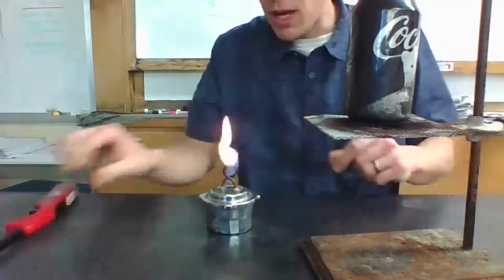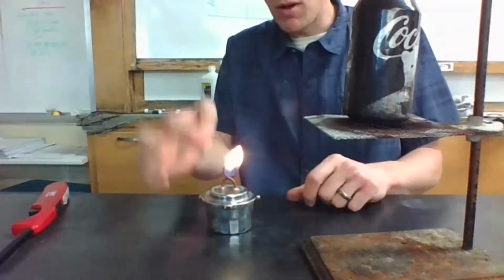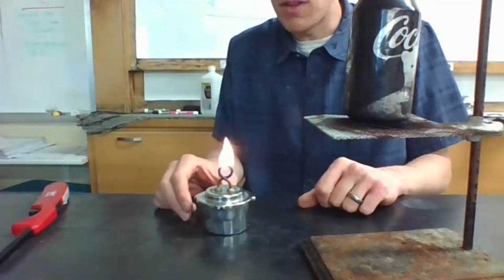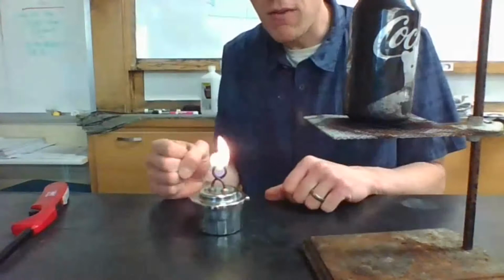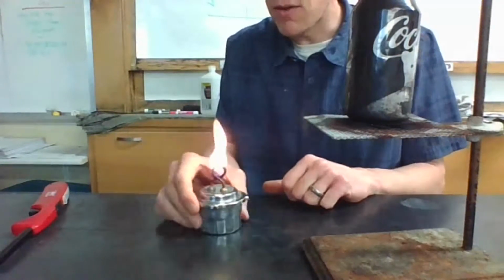So it is full of ethanol right now. And so slowly some of the ethanol will be kind of wicked by a little string that's going through up here. And so right now I'm actually burning the ethanol that I placed inside of this. I'm going to be using that to heat up this water here, and I'm going to measure the amount of ethanol I use. So how are we going to do that? Well, let me show you. We got some data to collect first.